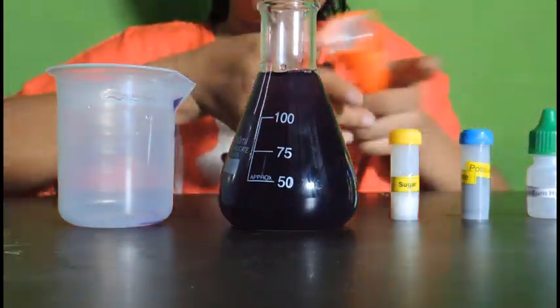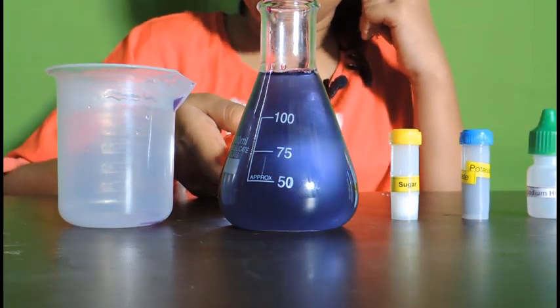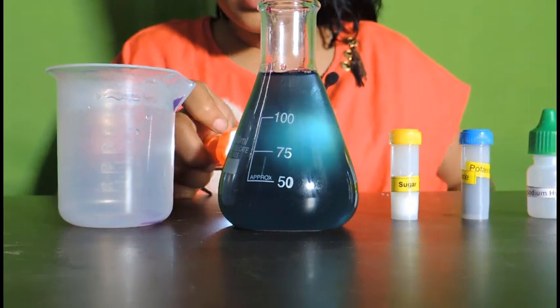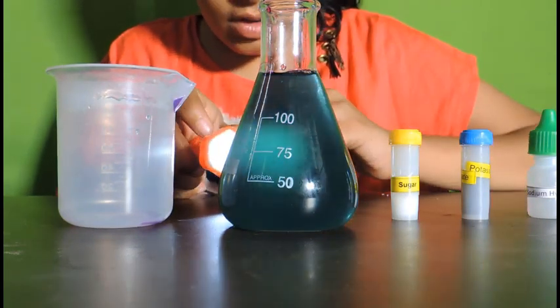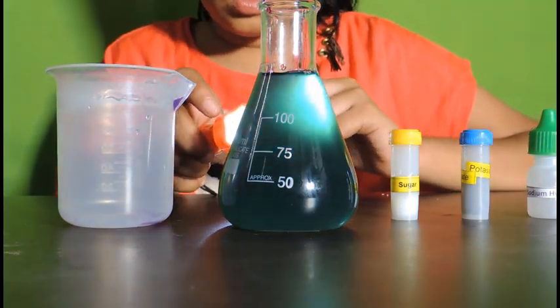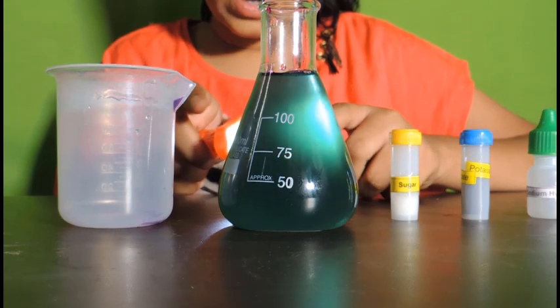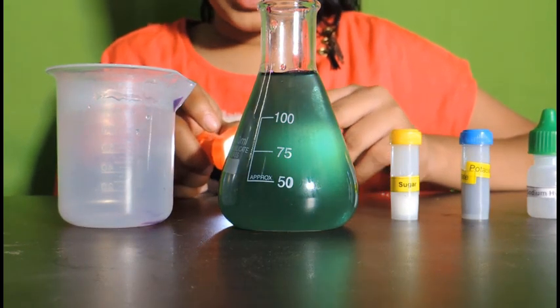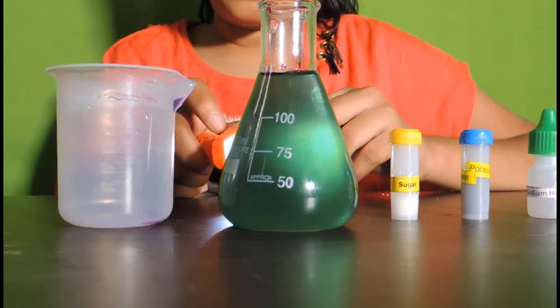Note the color change. It's blue now. This is because of the transition phase. Now it's turning into green. This is because when one electron is being added to potassium permanganate, it turns into potassium manganate with valency plus 6.